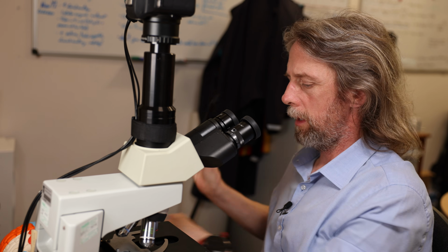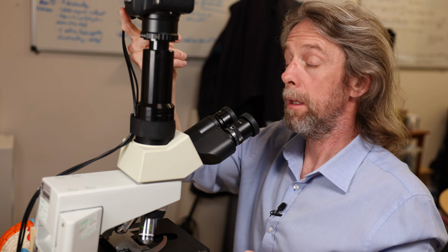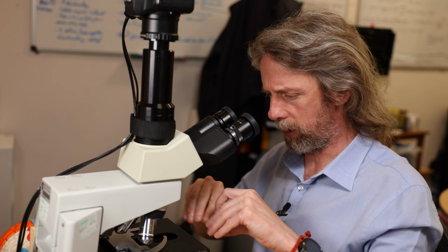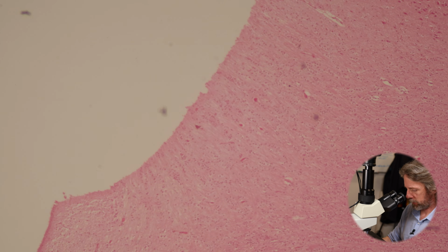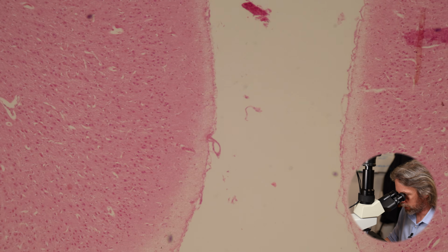Okay, so our first job then is going to be to compare grey matter and white matter, isn't it? Our first job is going to be to switch everything on. All right, what we got? So I wanted to show you the whole layout on the slide because I'm not going to be able to fit it all in under the microscope. What can we see?